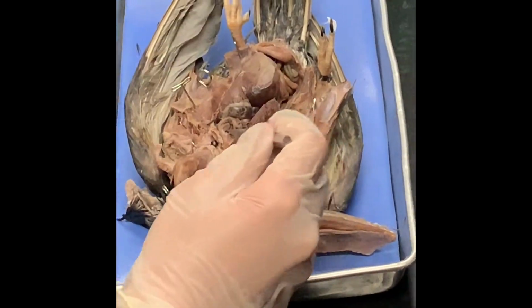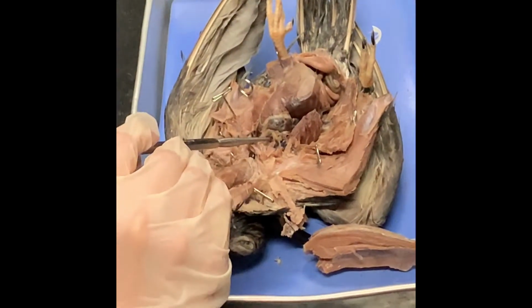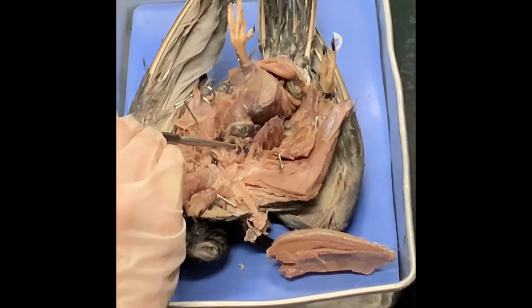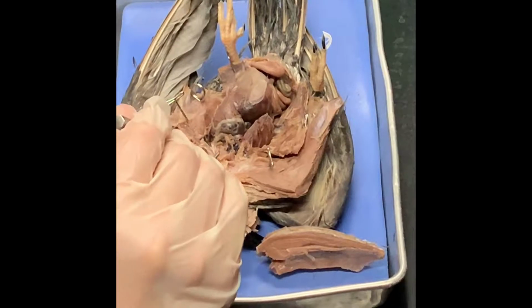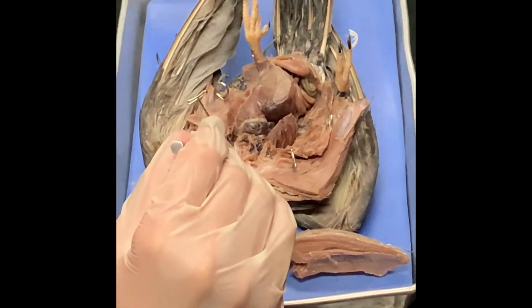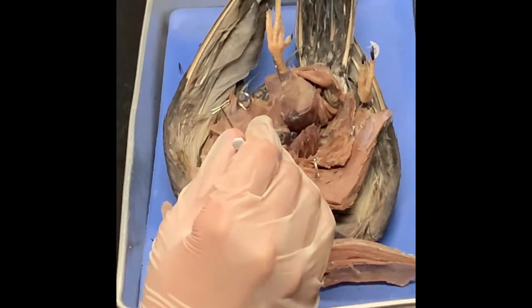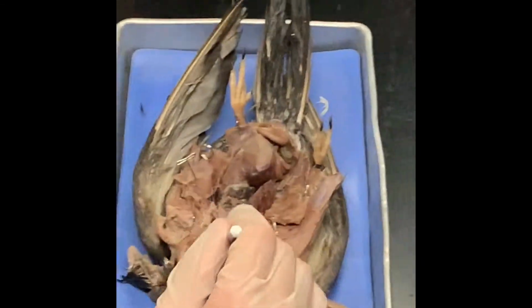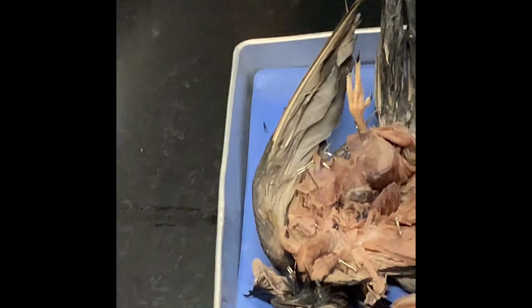Where's the air sacs? We couldn't find any air sacs. I don't think we will. It sort of goes further down. And you could point out again what the crop was covering. So what's next to the trachea there? There's this thing. So it's the crop, the gizzard, and then the stomach.